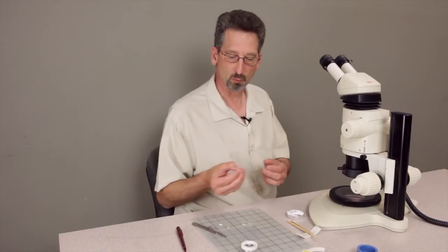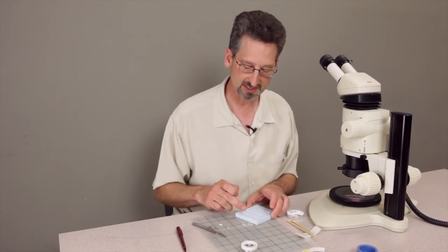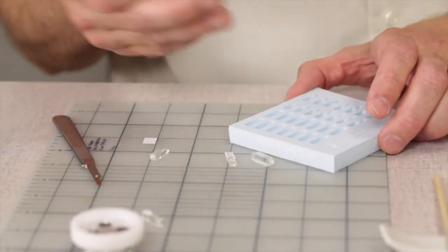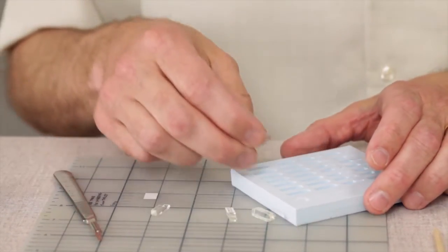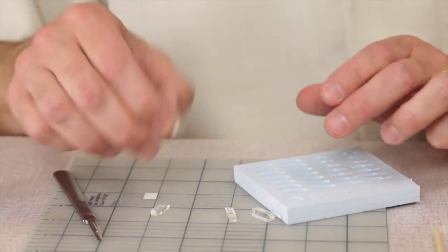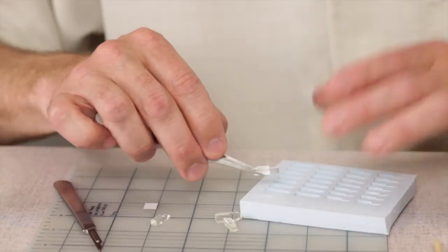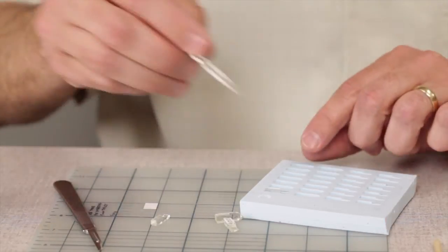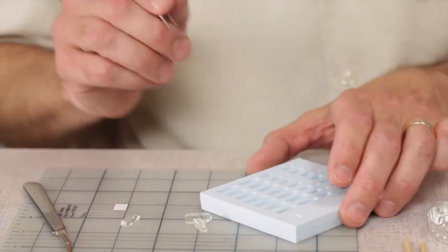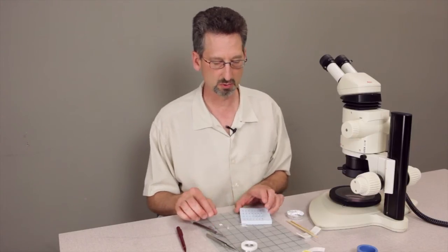Then once I'm finished I would place epoxy into the full size portion of the mold, maybe five to ten droplets of epoxy. Then using a pair of tweezers I could drop the cast sample inside, the first half of the mold, down into the silicone rubber mold, and then I'll add more epoxy to the top until this mold is filled.